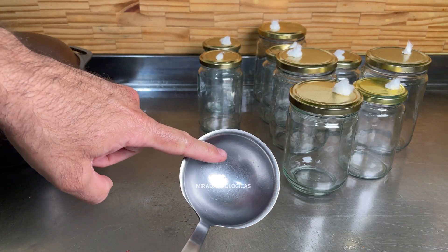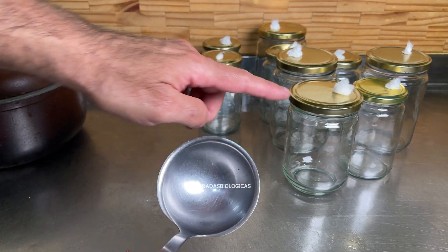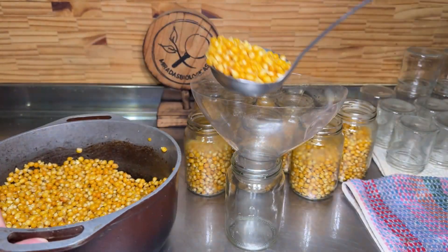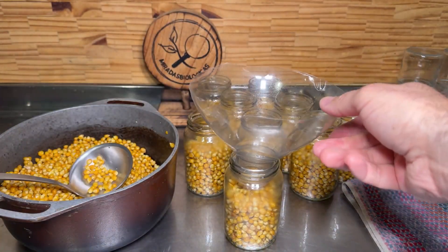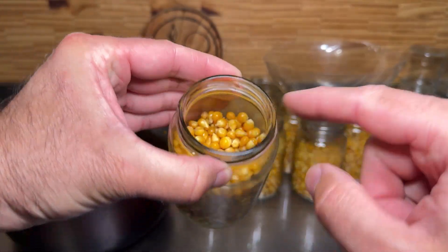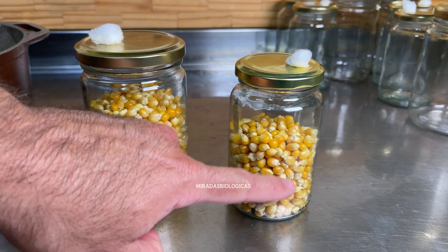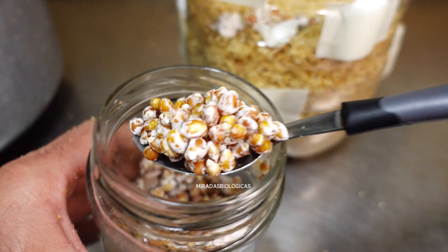Keep in mind that since we're going to grow these mushrooms on these corn kernels, any competitor could end up making us lose the entire culture. That's why I always recommend keeping the place where you're working as clean as possible. I recommend going a little over halfway when filling the jars, leaving a good amount of airspace so good gas exchange can occur — allowing the carbon dioxide produced by the mushroom to escape and be replaced by oxygen so it can continue to live. We need the grain to look rather dry on the outside, but already cooked and well hydrated with water on the inside.